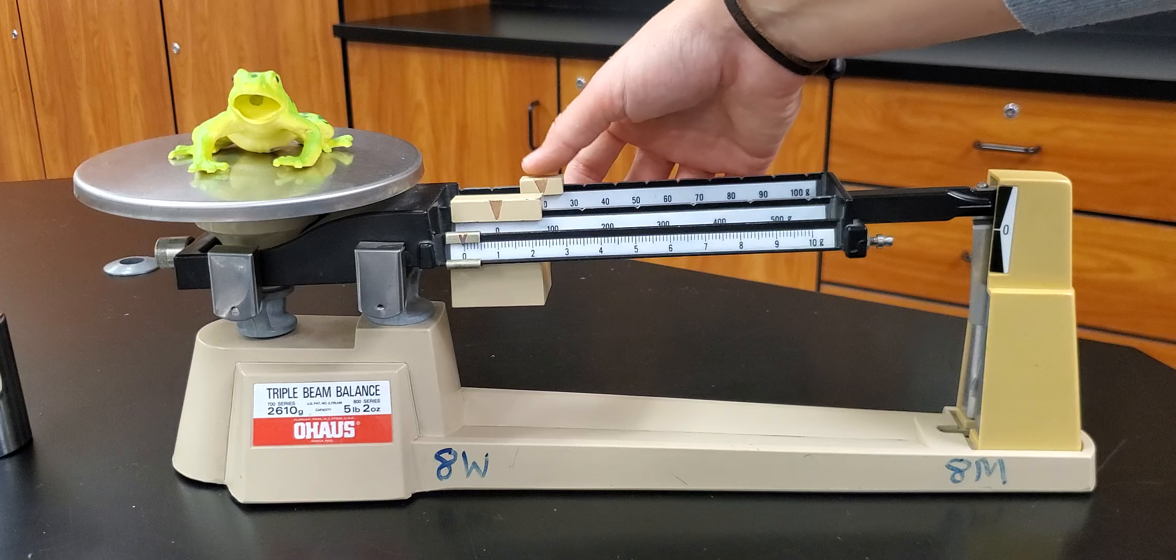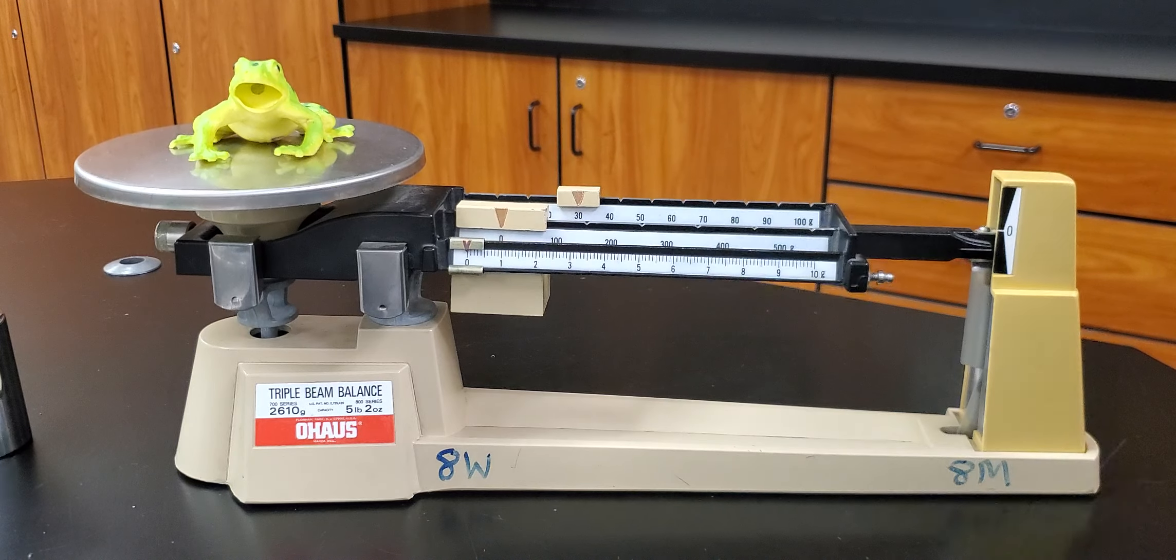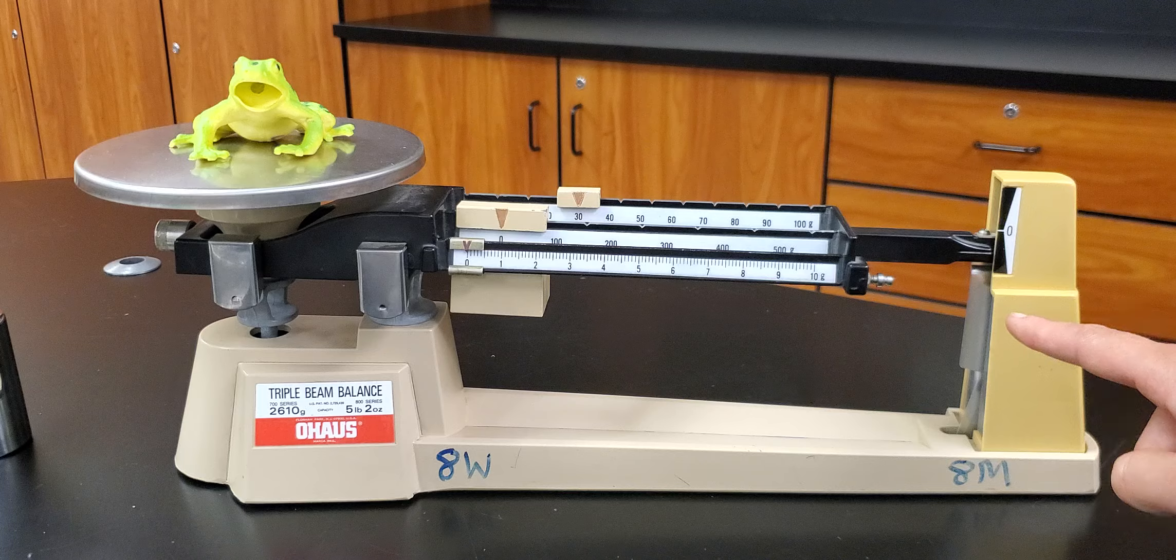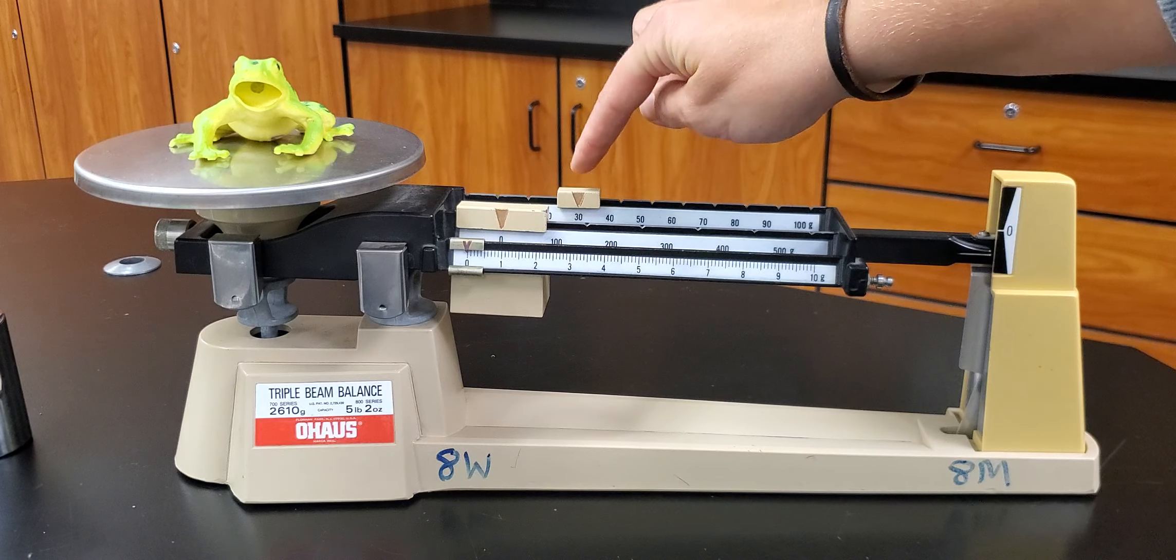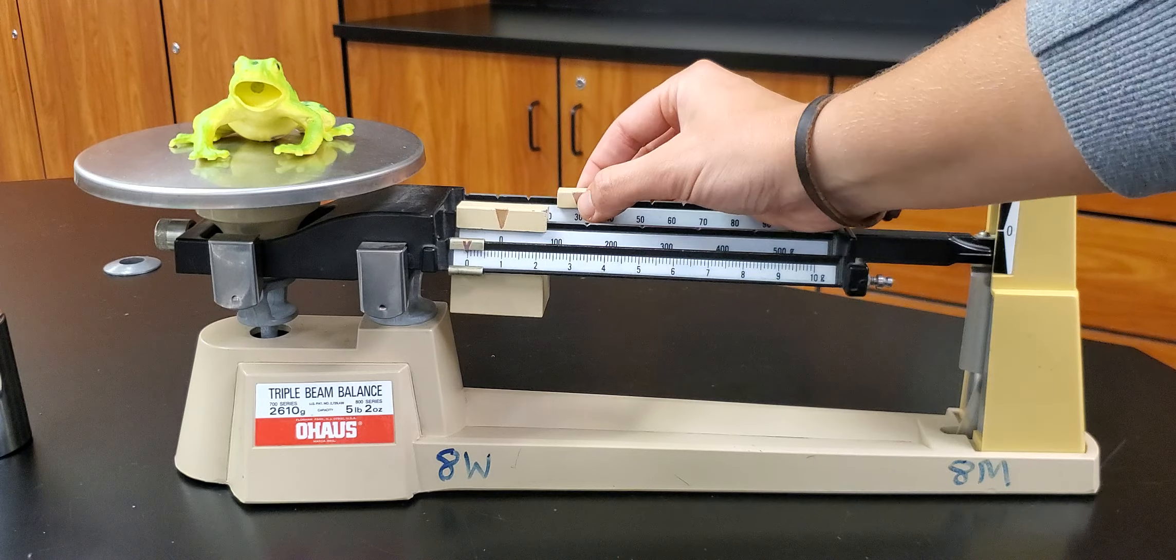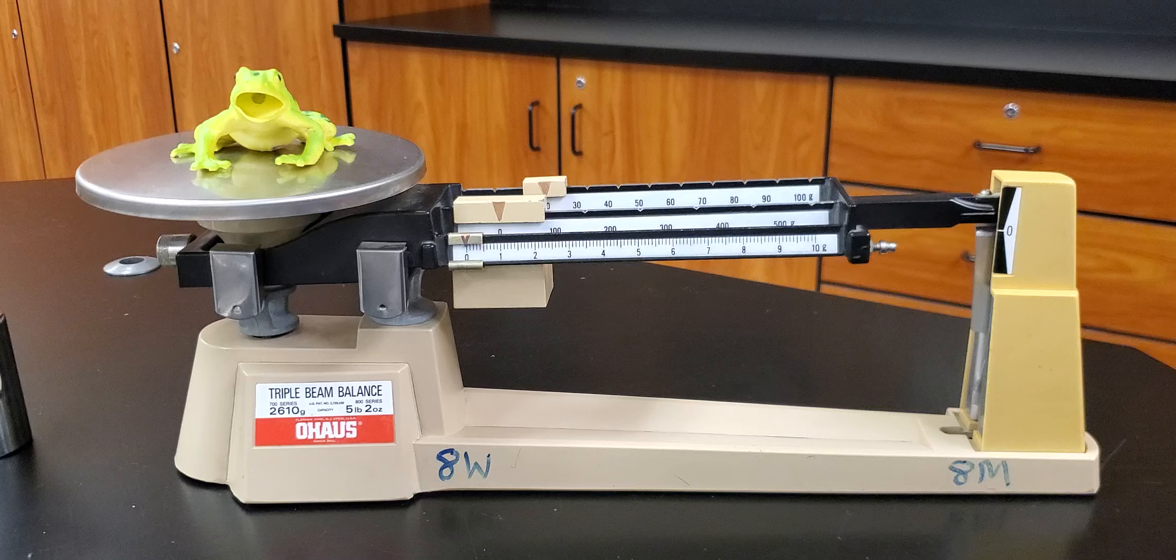20 still isn't enough. And 30 is too much. The arm went down in the 30 spot. So that means I need to back it up one and put it back into the 20 spot. Okay?